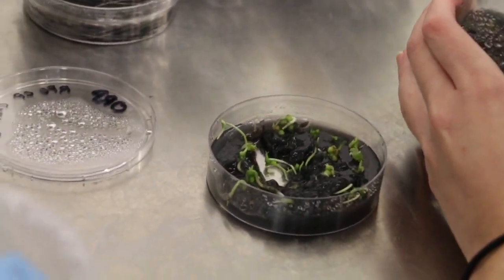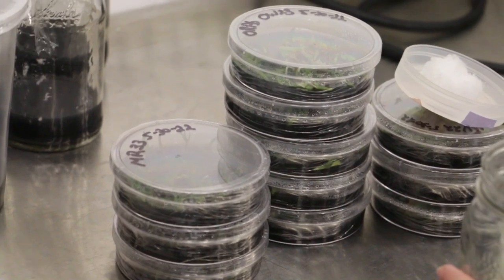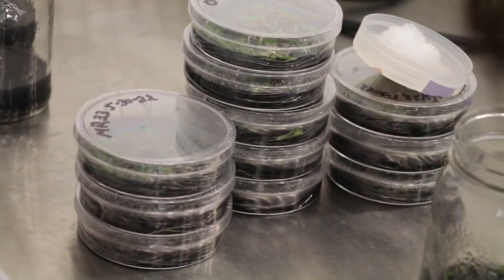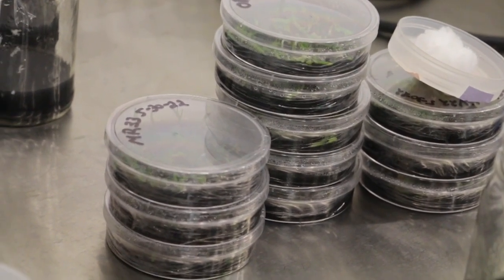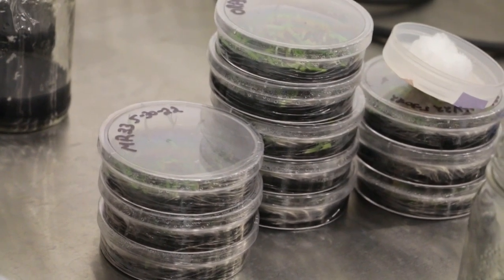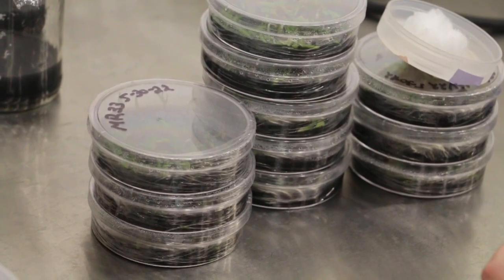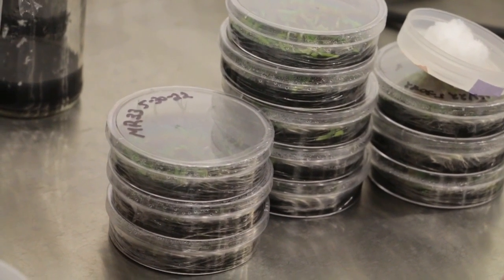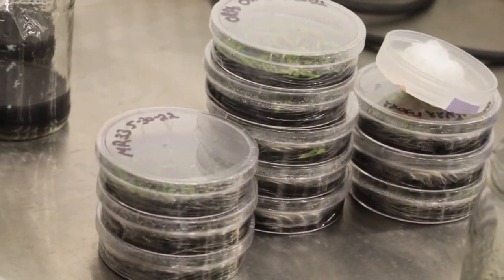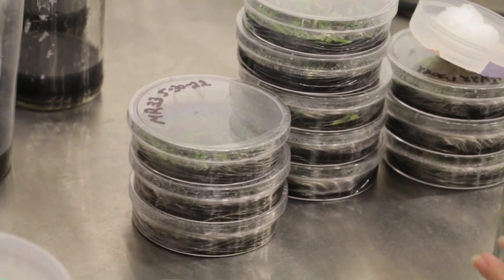That's all I have today. There's not much going on beyond transfers — just a lot of those plates, all containing orchids from the various crosses that I have. Depending on how long it takes for us to run out of the replate medium, we're going to tackle these as long as time allows. I hope you enjoyed watching things in the hood as far as transferring these seedlings and seeing what's going on in the lab. Happy propagating.